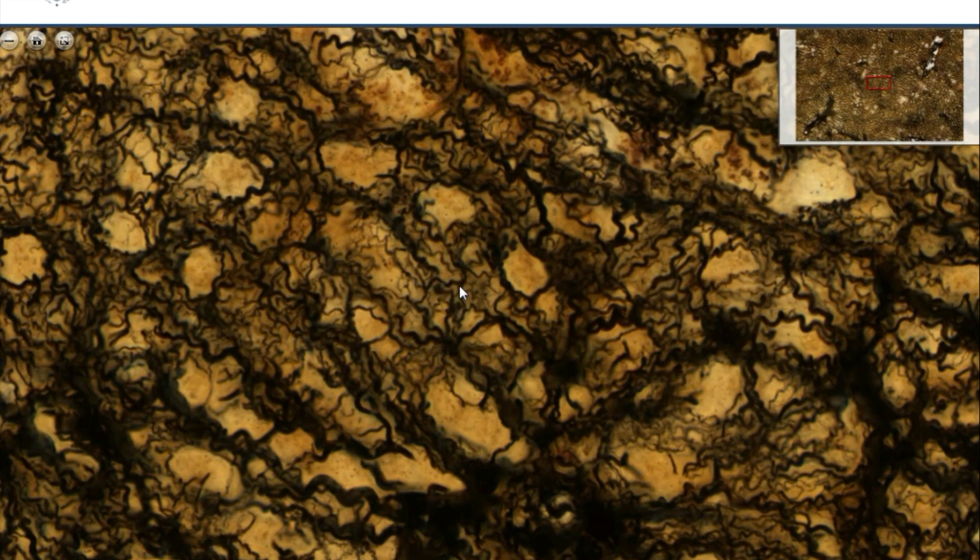This tissue is not reticular connective tissue — these are reticular fibers from the liver. Please see your textbooks and the lecture material to find out where else we may find reticular fibers.